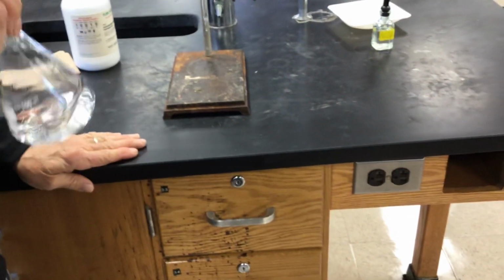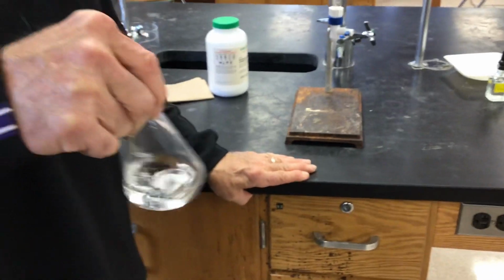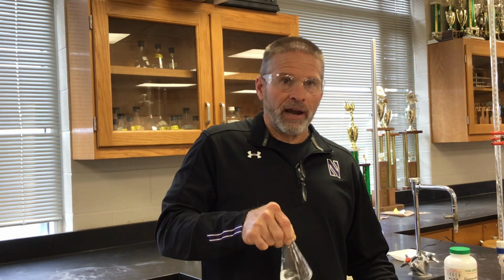Now, normally what happens, if we were in a chemistry lab at a university, they would tell you to run titration trials until you had 3 trials that agreed exactly. Trust me, that could be a lot of trials.